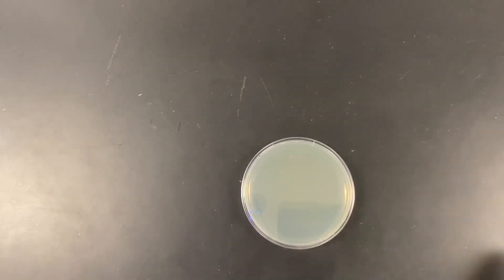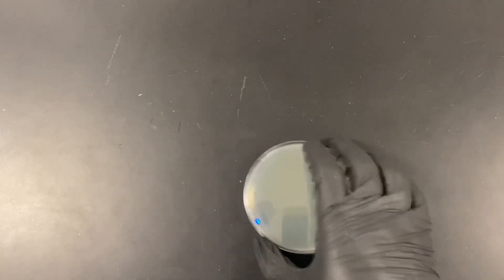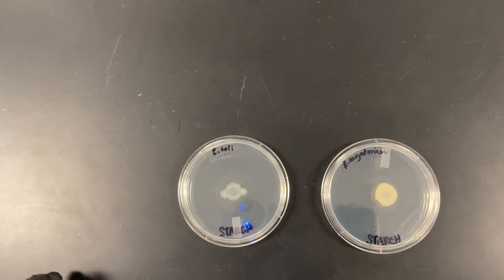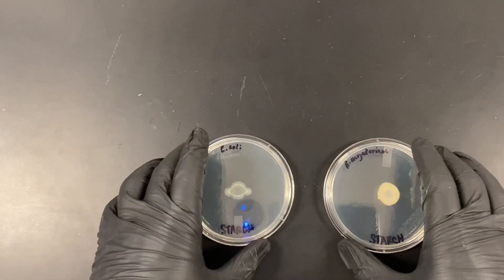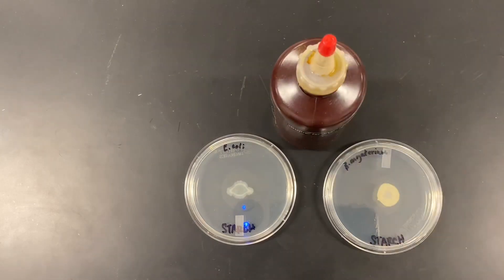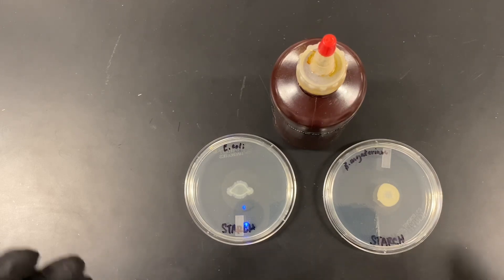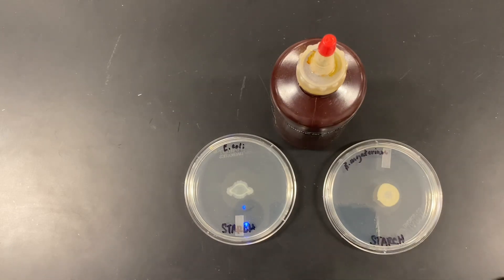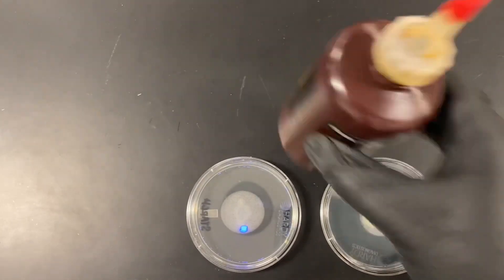In lab 21, we use a plate enriched with amylose or starch. We inoculate it and see if the organism can utilize the starch present. However, starch is relatively translucent and difficult to observe directly, so what we do is take these plates and add a little bit of iodine. Iodine tells us when starch is present — starch remaining on the plate will turn dark, ranging from brown to black, while areas where starch has been consumed will remain clear.